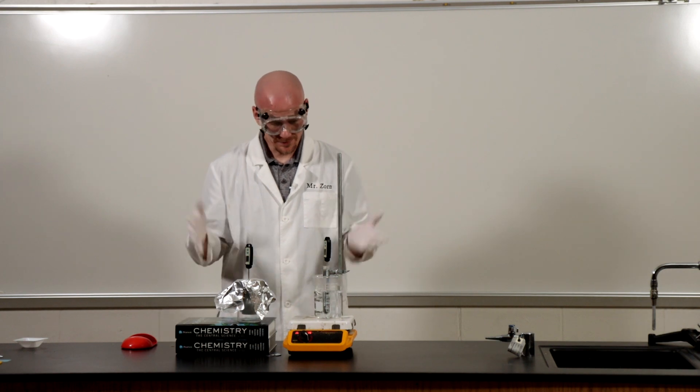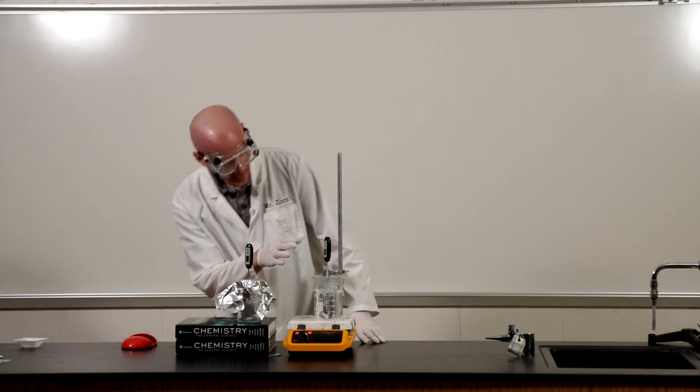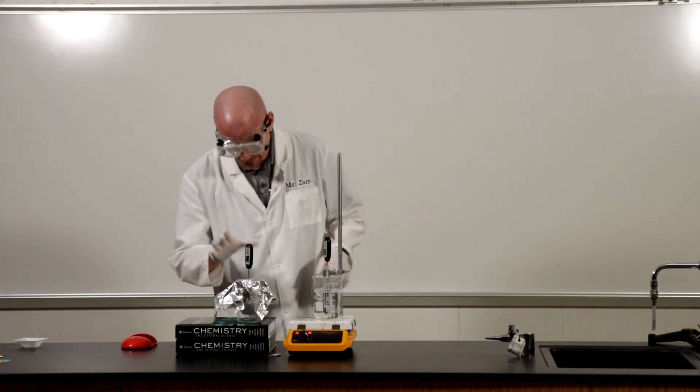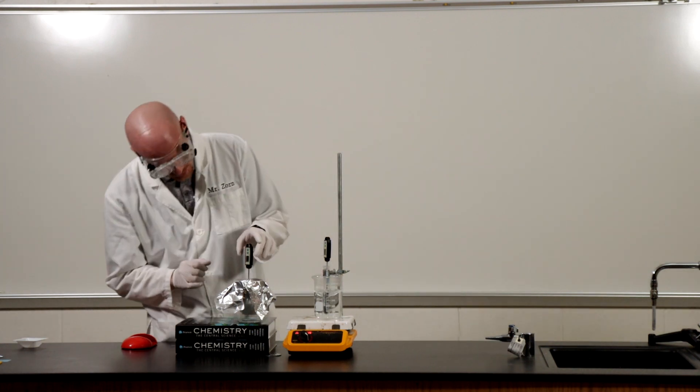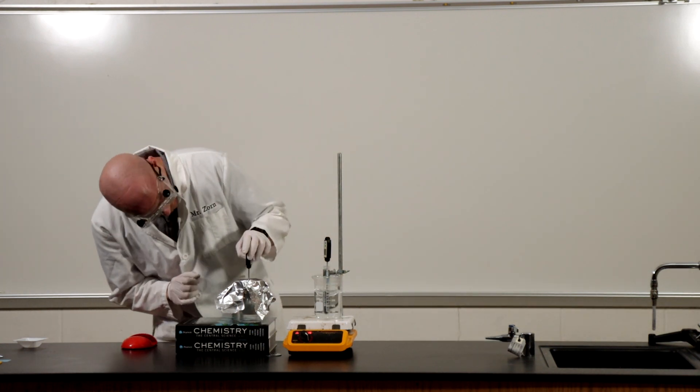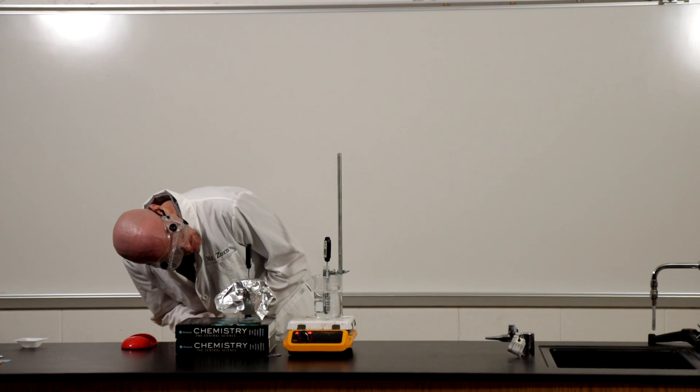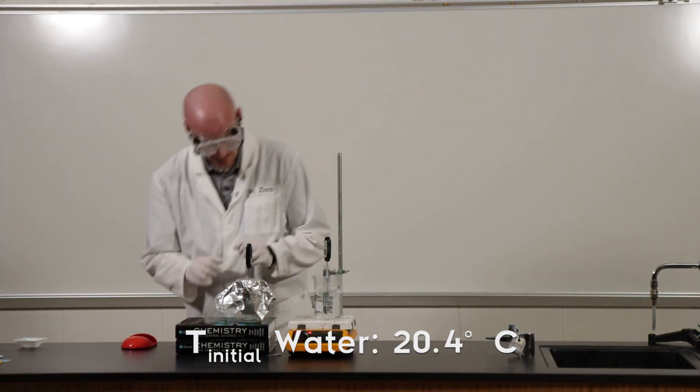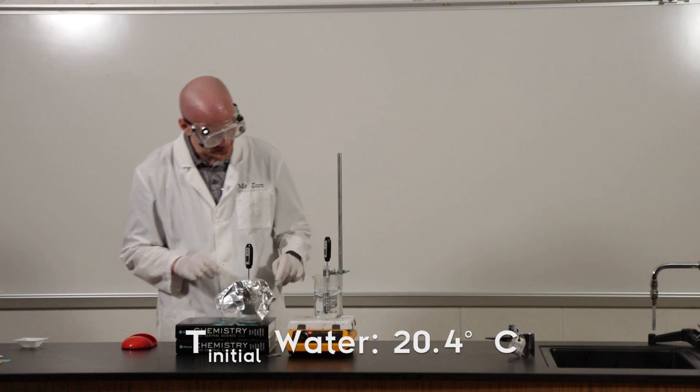All right, now it's time for the moment of truth. So I've gone ahead and got my calorimeter set up here. So the initial temperature of our water is 20.4 degrees Celsius.